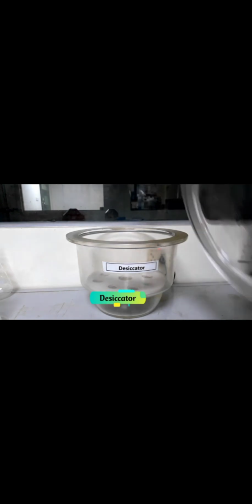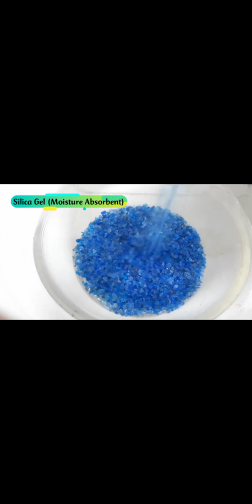And finally, desiccator. The desiccator works mainly with silica gel as a moisture absorbent, which aids in cooling of dry samples or chemicals. The major work of a desiccator is to cool down the temperature of a substance placed in it. A desiccator is also used in maintaining anaerobic condition, which is also one of the most important functions of a desiccator.